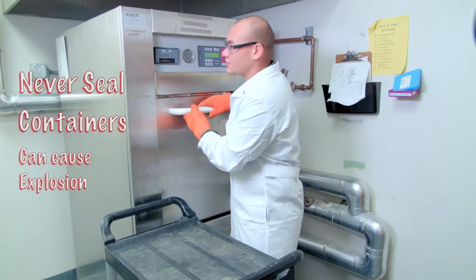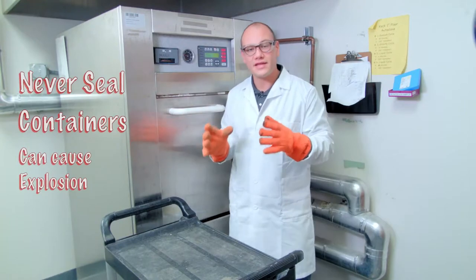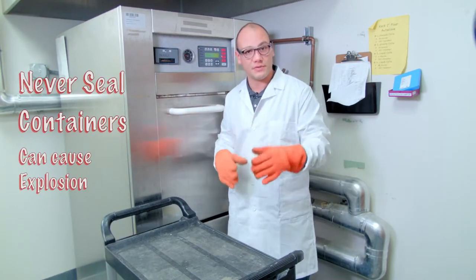Anything that goes inside the autoclave should never be completely sealed. If it is, as it heats up it has the potential to explode.